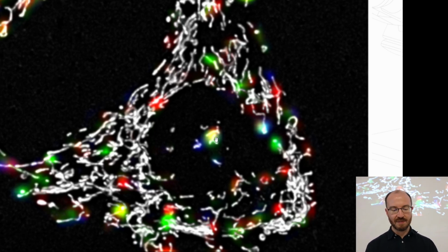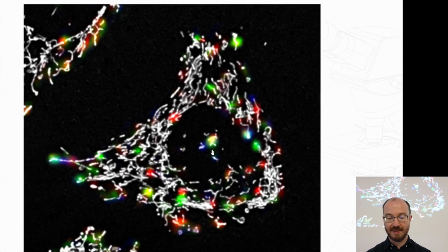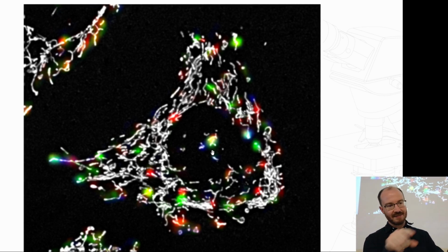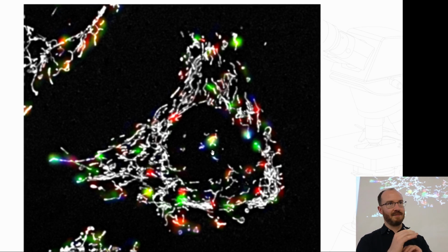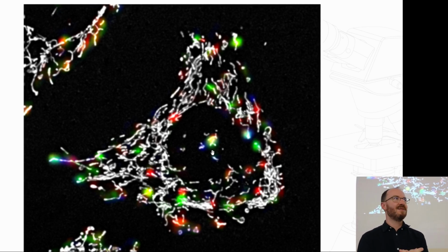So after we filtered out many of the obvious things that are wrong, we looked at the ones that remained, and we literally by hand considered each one of them individually and said, in frame 1, frame 2, the neural network said there's a green dot. Does it make sense? Yes or no? And then we got about 40 to 50% accuracy. So 40 to 50% of the dots that it placed were actually perfect. It was accurate. Many of the others you could say are reasonable, but objectively they're not. Now, remember, the neural network did not see 2 frames.